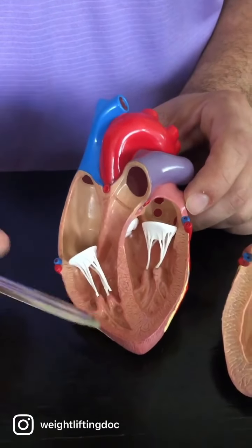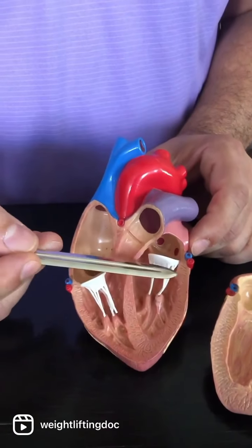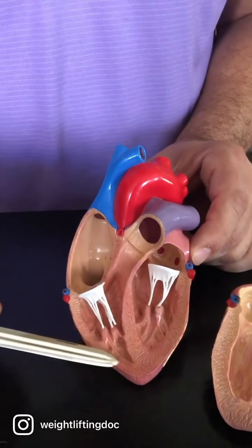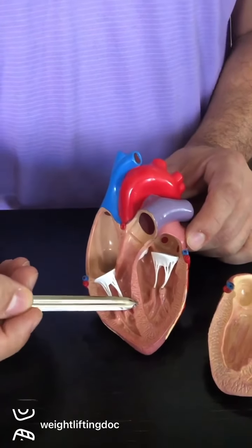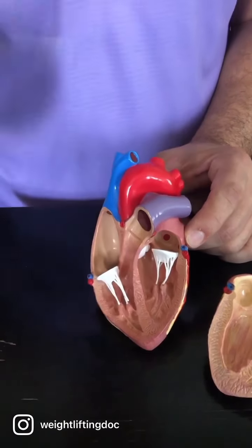Okay, another thing I want to show while we're here is that 95% of the heart is made up of the myocardium. So this is all myocardium here. This is also myocardium. I would probably point to it somewhere out here. But in the center here, which is myocardium, it's a structure though. And so if I point here, I'm going to be asking for the structure. And so that is called the interventricular septum.